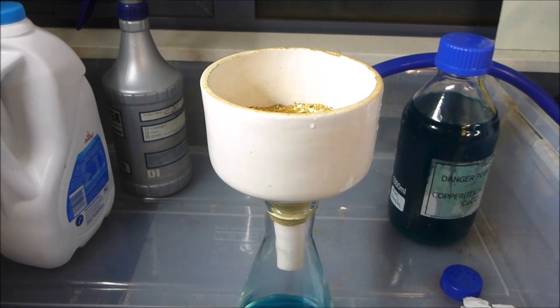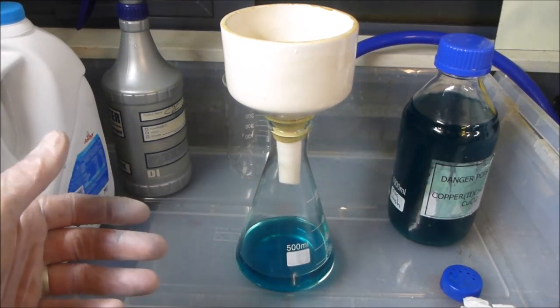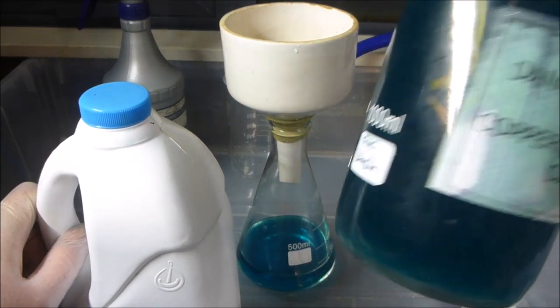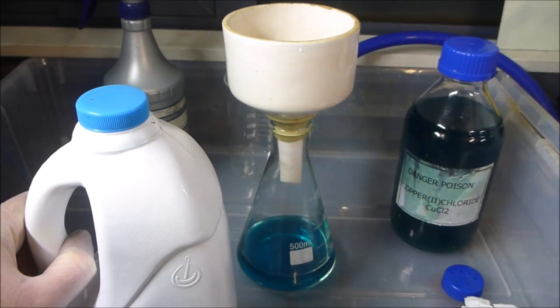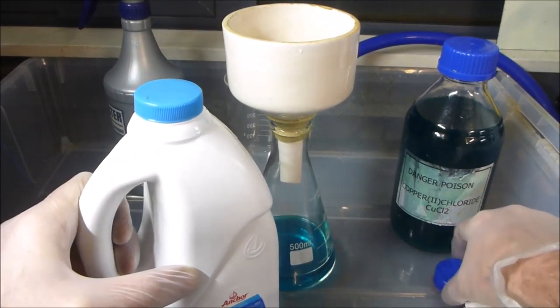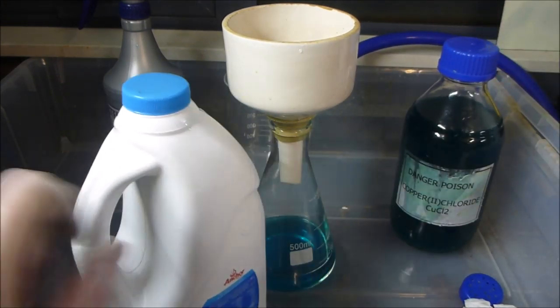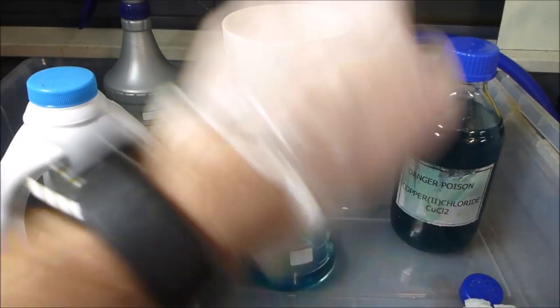So one of the first things I do is, let's move this out of the way a little bit, those fingers that I've drained off all of the concentrated AP solution, I transfer them into a sealed container like this, and then I have a container of wash solution like that, and I reuse that container of wash solution all the time, just filter it, pour it back in. So pour some of that into this thing, shake, shake, shake in all directions, and then I've got a cap that I just drilled some little holes in, and I'll use a funnel in that bottle and tip from this one into that one, and that makes all of the little gold foils that were still stuck on the fingers accumulate in there, and then I put that through the filter as well.